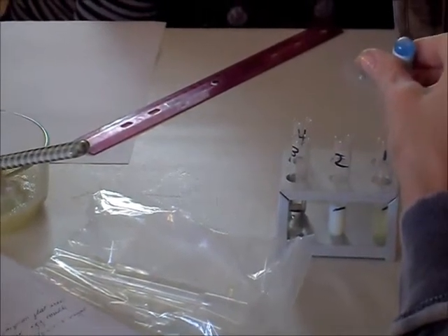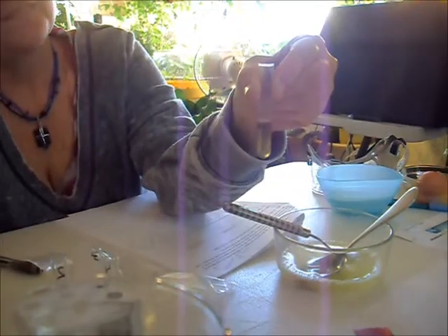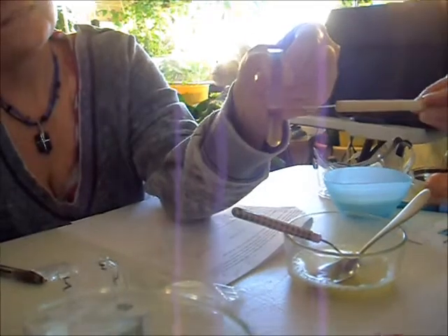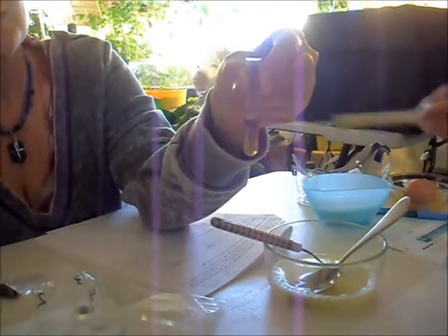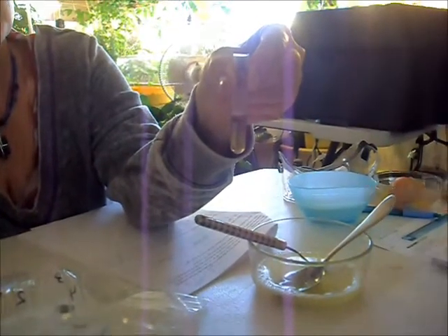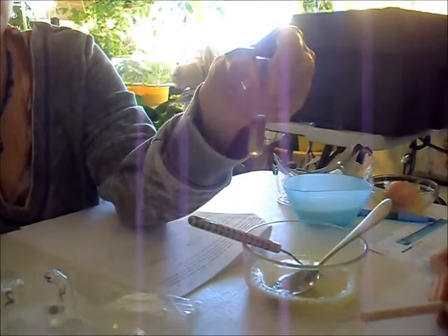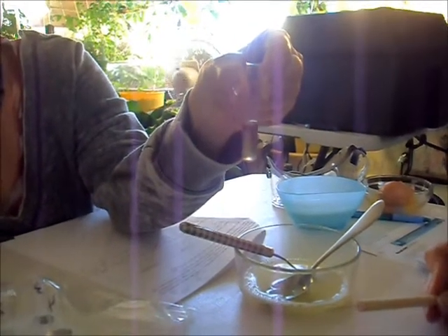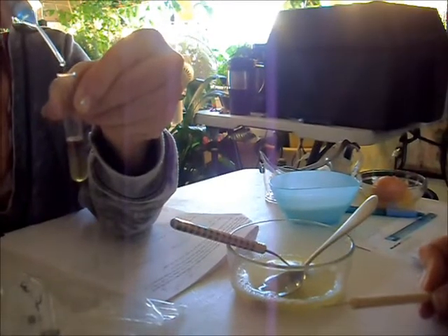Do you want any color at all, or just the whole thing to change colors? Now we're adding the Biuret reagent, and you need to stir it a little bit. Cindy's using an item from the dissection kit. We put in fifteen drops, and now we just get a slight reaction. So put fifteen in all the other test tubes.